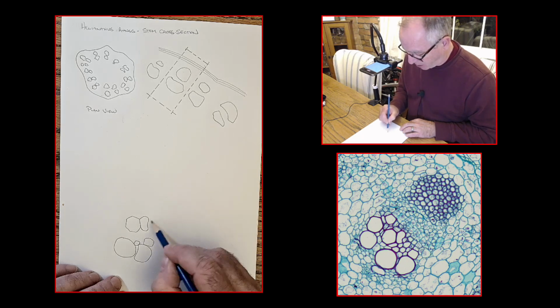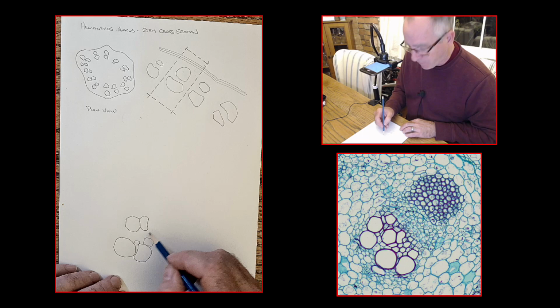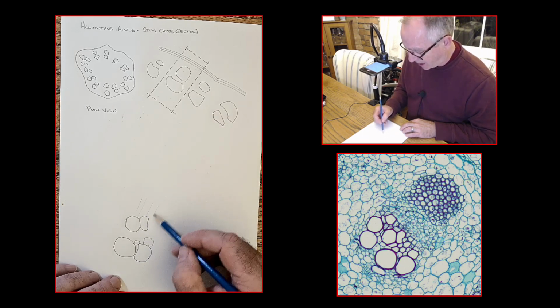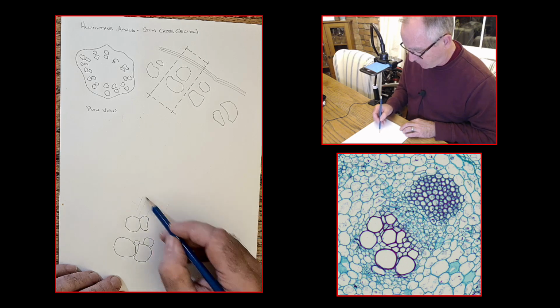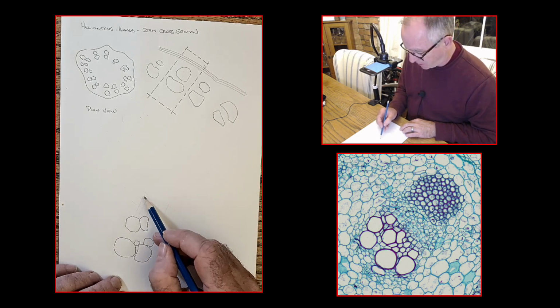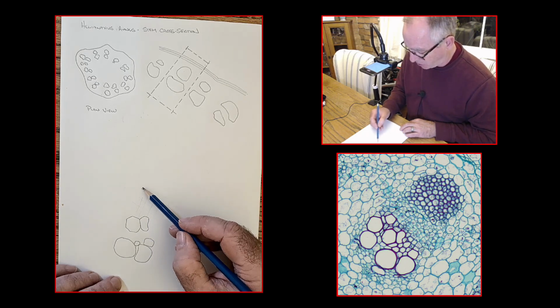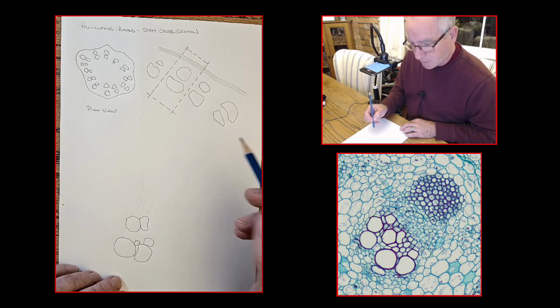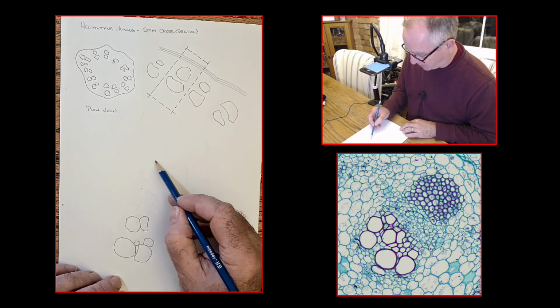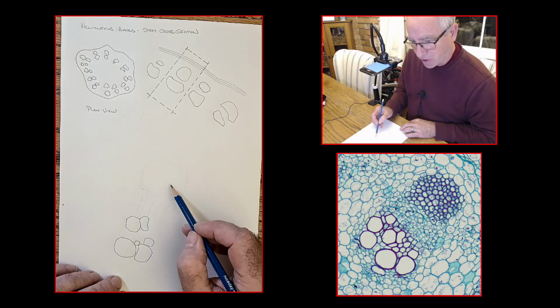Eventually, I'm going to take my time and I'm going to fill in everything that's in this space here. But for now, we come to a region of little teeny tiny cells. What I'm going to do is just draw some hatches. This isn't the final version. I'll come back and I'll use my eraser and I'll rub that out and I'll put in some of the details of those smaller cells because they're very important. And then we've got a circular region here. I don't know that I've left myself enough room. We're going to cut that circular region off about here. So you see what I mean? I'm even planning as I go along where things are going to go.